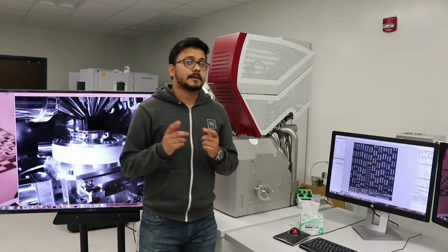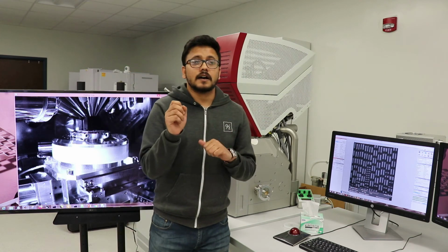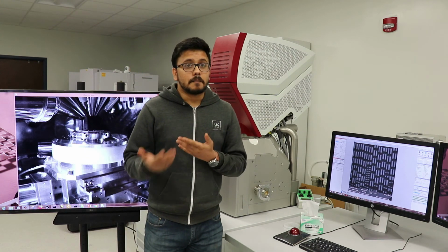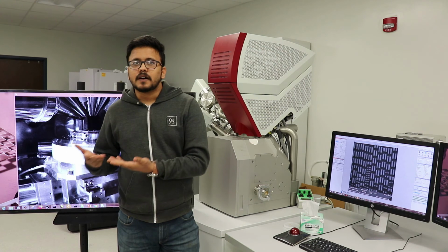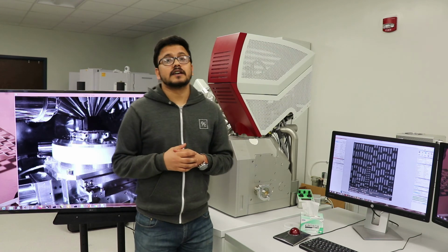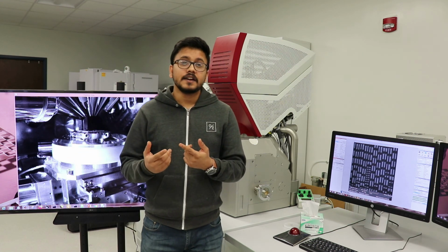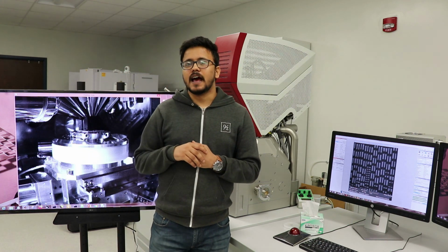Now I'm going to show you that sometimes these ions which I am using to remove a particular structure, or to remove material from a very small location, sometimes that location is much smaller than their capability. Sometimes the editing I am going to do is around 5 to 10 nanometers, which is beyond the capability of the system. So now what I need is another ion beam which has the capability to edit up to such a small level. This is where another instrument in the lab comes up, which I'm going to show you next.